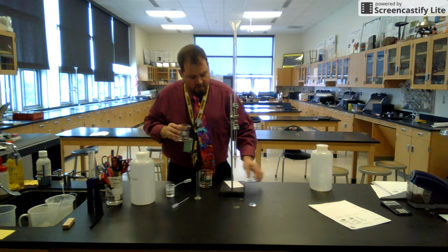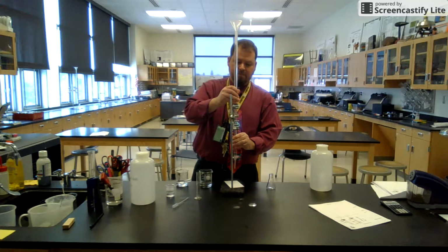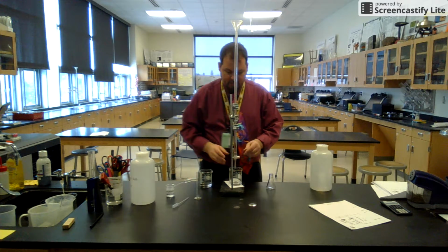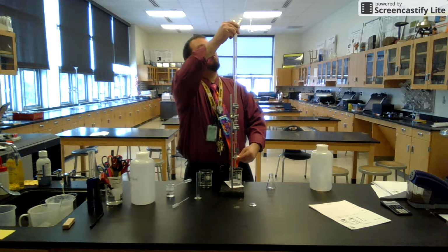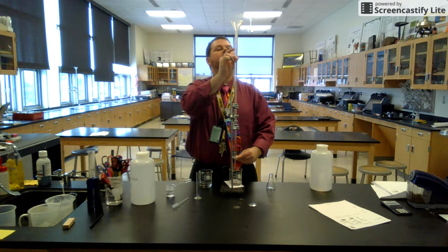Now, what I did was I overshot that 0 a little bit. I personally would like it to be right at 0 to make it easy for me. Get out my bubbles, back into the base I had. I'm going to let a little base out until I get down to that 0 line, which, in case you can't see, is right about here.